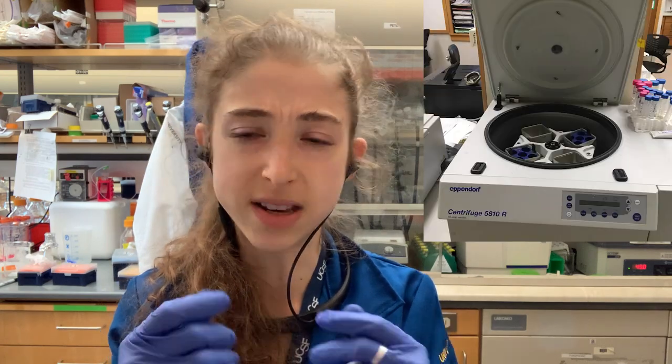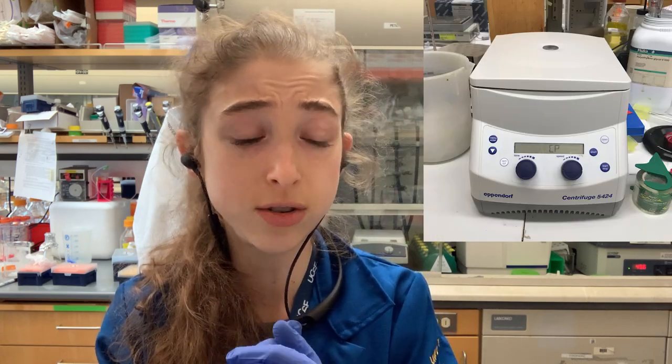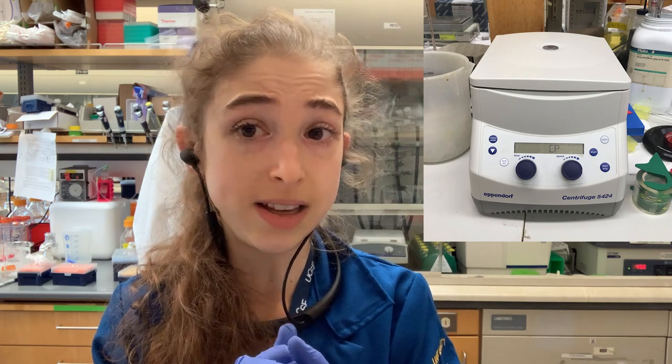Swinging bucket rotors are often used for the common benchtop centrifuges to spin down Eppendorf tubes or larger falcon tubes. Microcentrifuge tube centrifuges are typically fixed angle. Both types are used for pelleting.